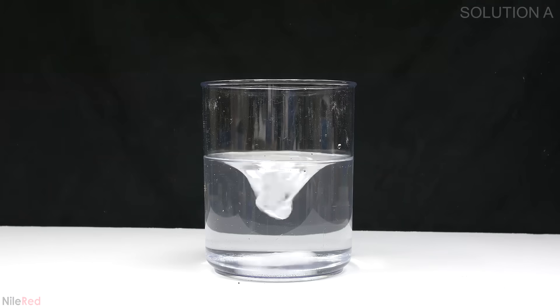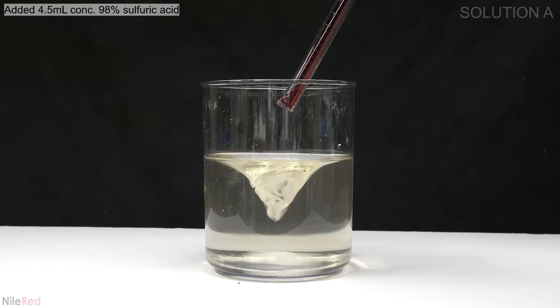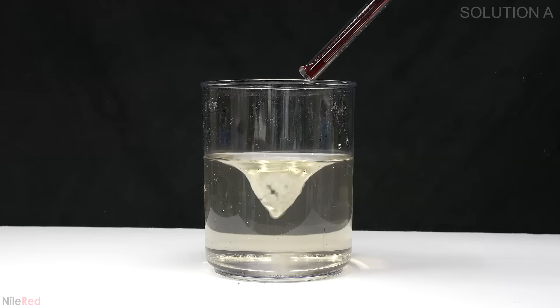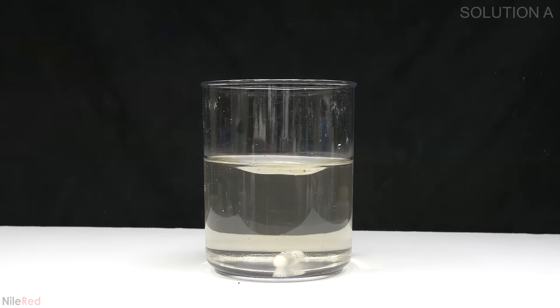After about 10 minutes it looks like everything has dissolved so I add the sulfuric acid. As I said before my sulfuric acid was slightly discolored so the solution here becomes a little bit yellow. This is perfectly fine and it doesn't affect the reaction but it does make me a little bit sad because all of the solutions are supposed to be colorless. I let it mix for something like 30 seconds and then I turned off the stirring.